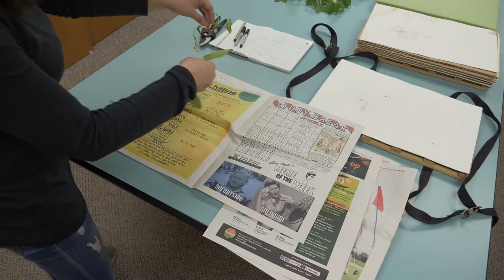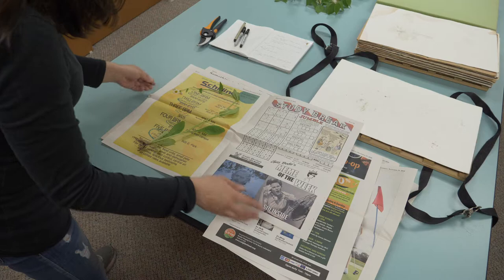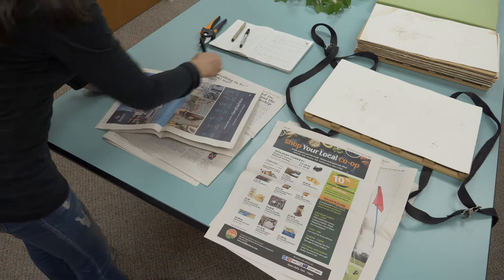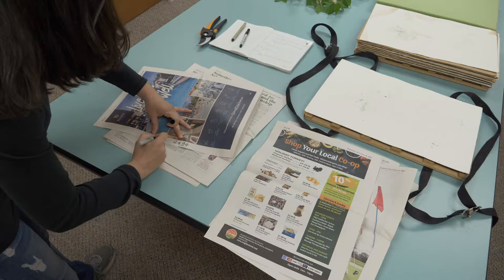Pressing a plant is very easy. You just place the plant in a nice way. In your newspaper you want some leaves facing up, some of them facing down. You want your flower to look nice. You don't want all of this soil. Looks nice and pretty. You close it and then you put the same number that you put in your notebook. In this case, this plant is 2,494 and I'm going to put my initials, so everybody knows that this belongs to my collections.